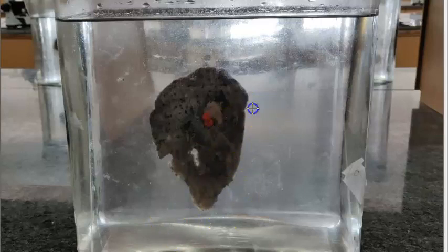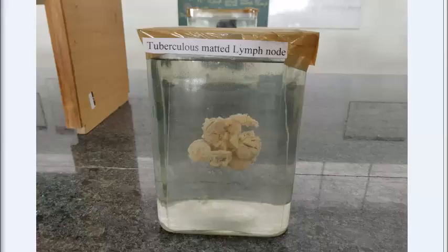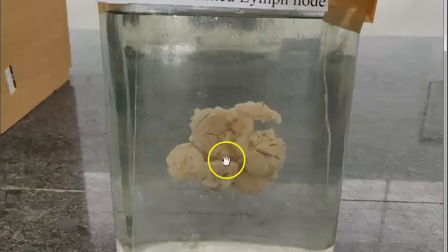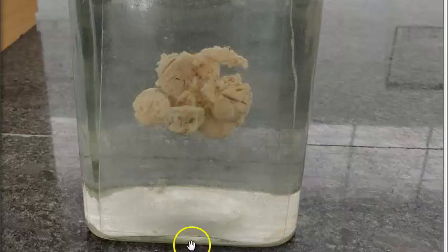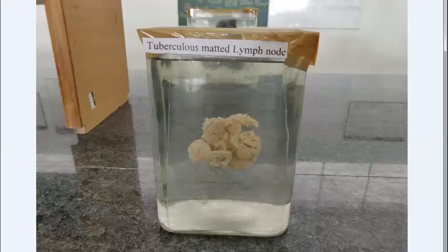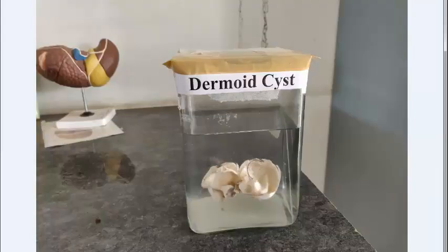This is a tuberculous lymph node specimen. You will see matted-together lymph nodes. In cross-section, you will see map-like areas of dry, cheese-soft necrotic material resembling dry cheese — caseation. In microscopy, you will see granulomas. Key words: matted together, map-like, dry cheese.